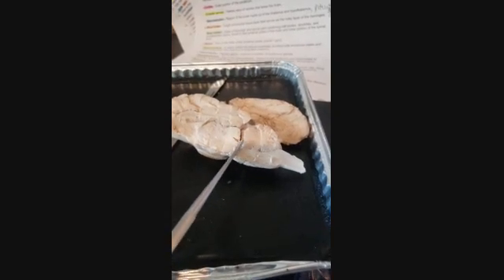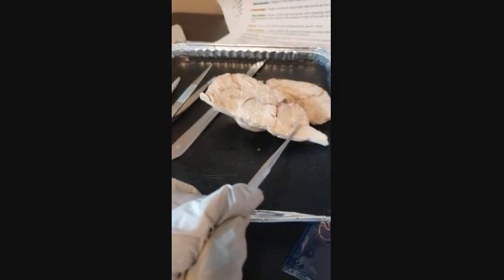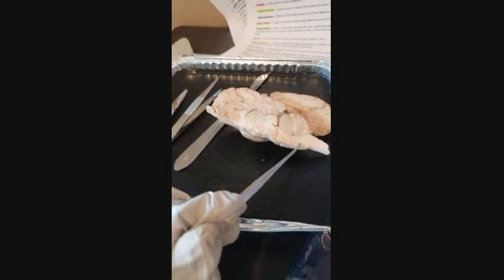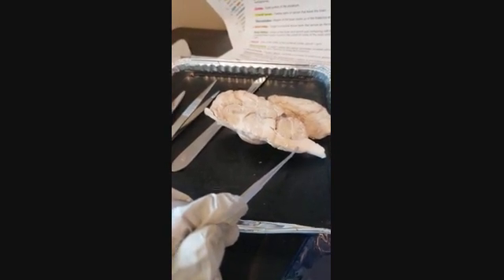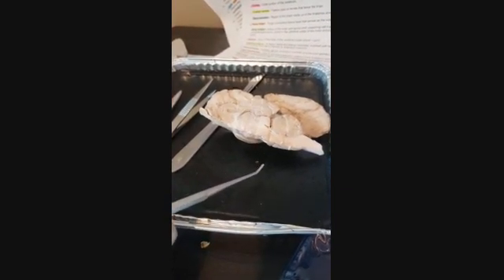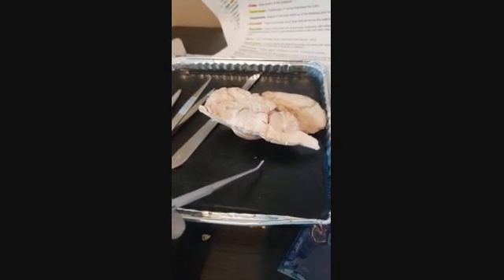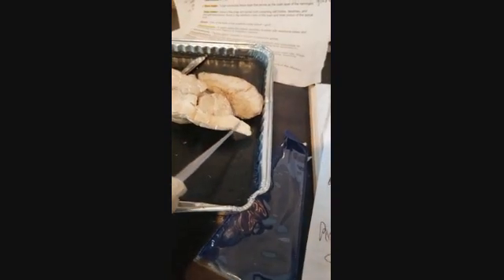Here's going to be our midbrain. The small bump here is the pons, and then we have the medulla oblongata, which is responsible for heart rate, blood pressure, and respiration, as well as sneezing, coughing, and hiccuping. The pons basically connects the cerebellum to the spinal cord and the brain. And then we have our spinal cord.